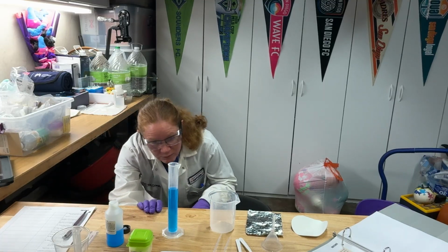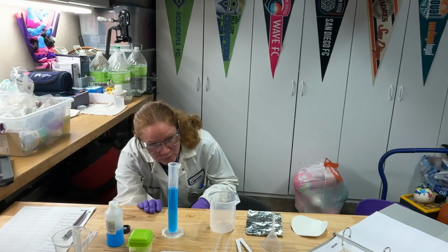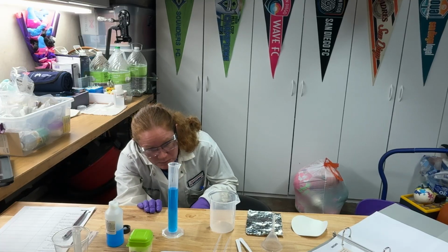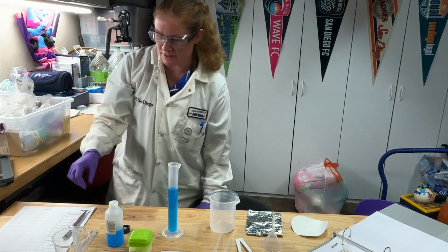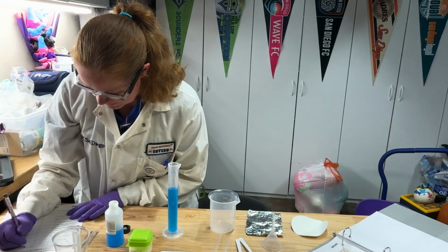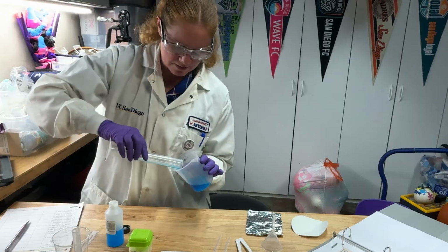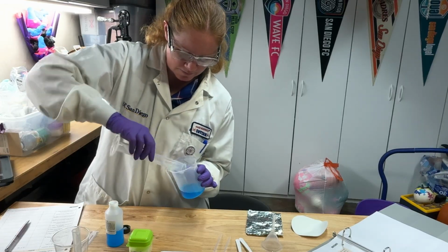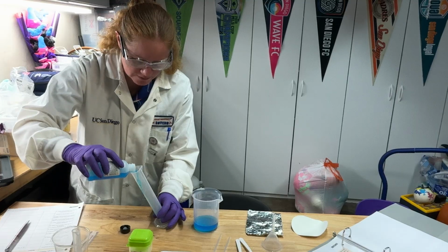All right, so I'm going to get down here, get to eye level. I'm at 47. Oh, it looks like I'm right under. So it looks like I'm about 46.9. All right, so I'm going to write down 46.9 milliliters here. Okay, pour that into my beaker. All right, and I'm going to pour out more of this.